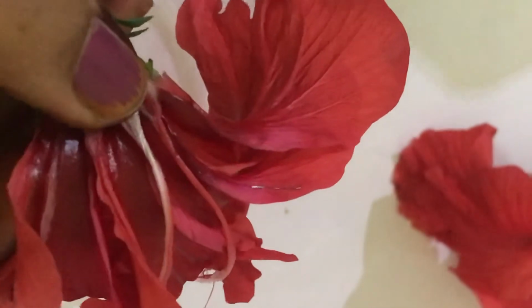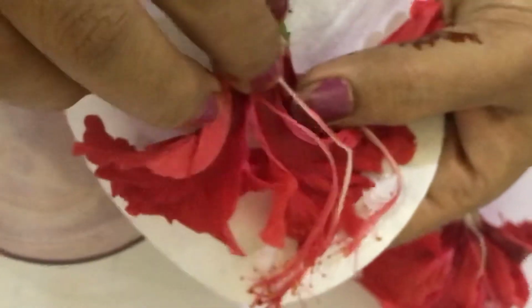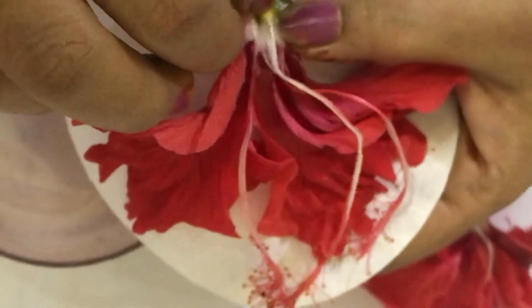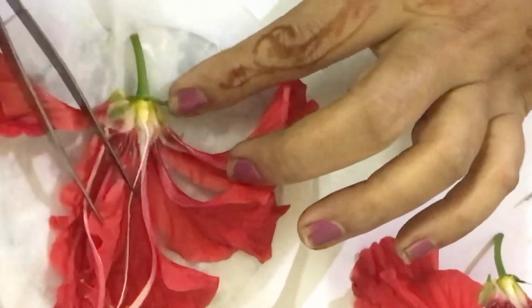After this, take a piece of filter paper, make it moist, and arrange the flower on it in such a manner that all the floral structures like the calyx, ovary, stigma and style are clear. I have already done one for you.